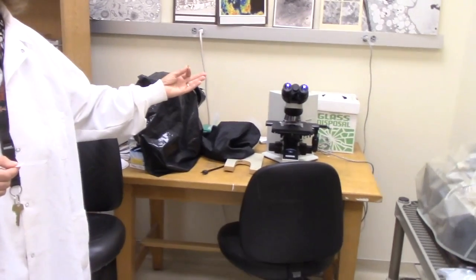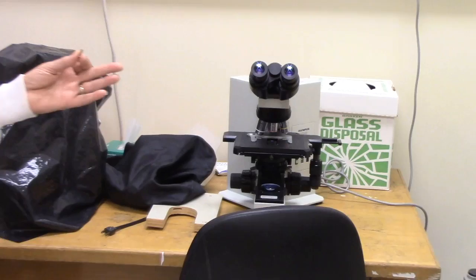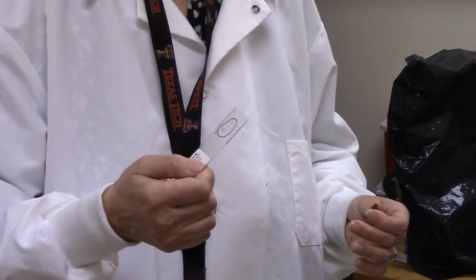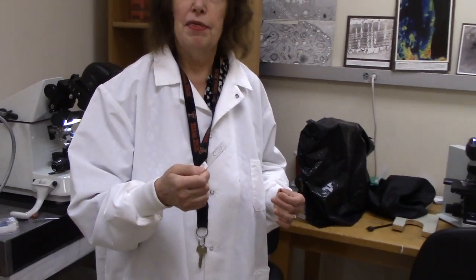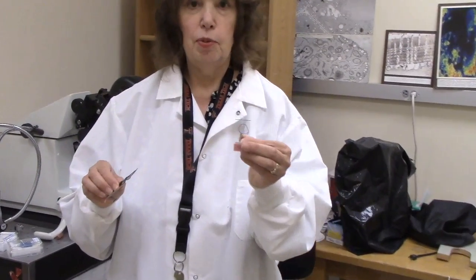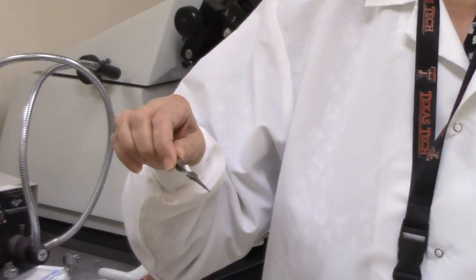I'm sure you're all familiar with a light microscope. If we were going to cut your sample for a light microscope we might put it on a glass slide, but a light microscope can only magnify something to a thousand times. We need to look at your sample at a much higher magnification to be able to see if there are any changes in its shape and size. So we're going to use an electron microscope, because an electron microscope can magnify something up to a million times — though of course we're not going to use a million x for your project. For electron microscopy, instead of putting it on a glass slide, we're going to put your sample on this grid.